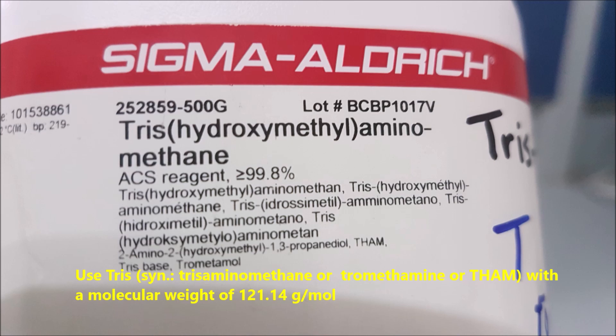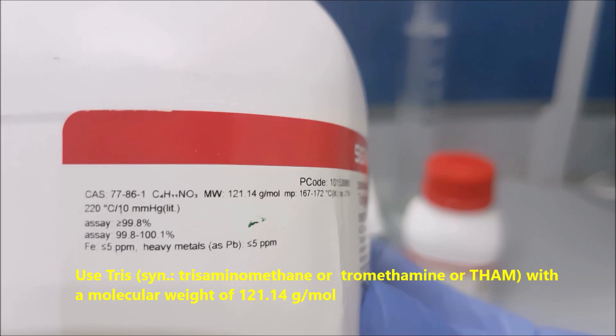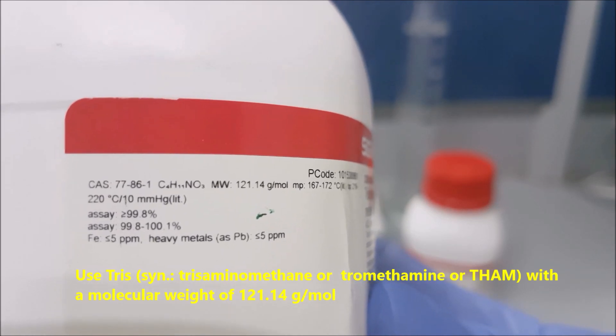Use Tris, synonyms: tris aminomethane, tromethamine or THAM with a molecular weight of 121.14 grams per mole.